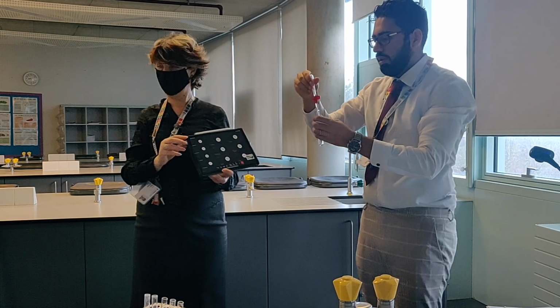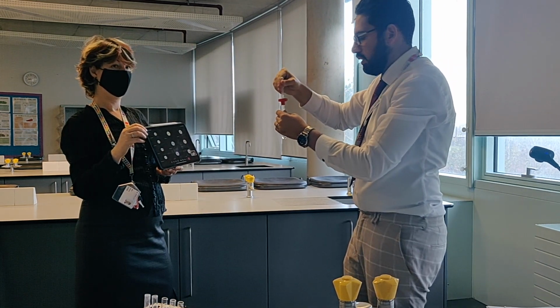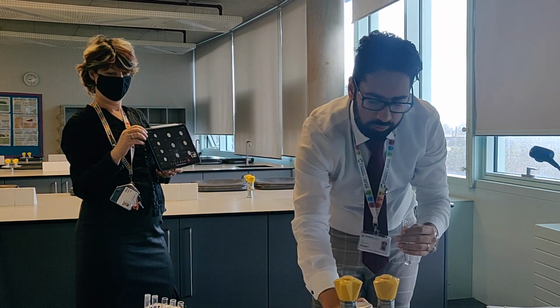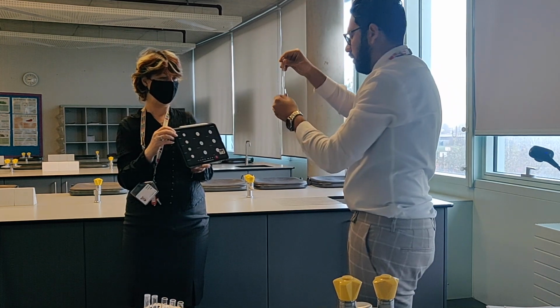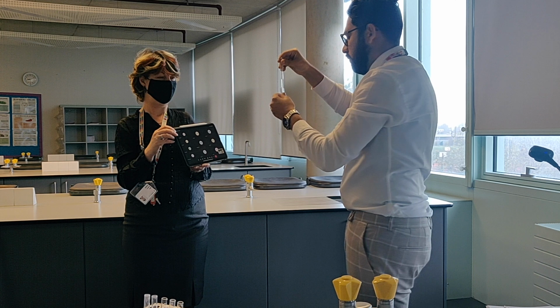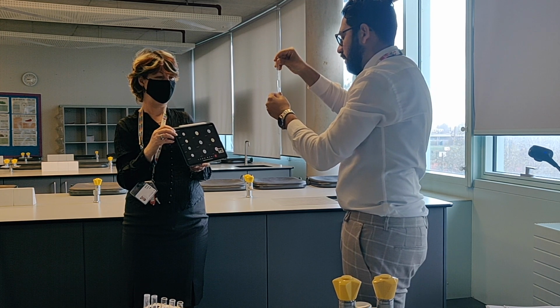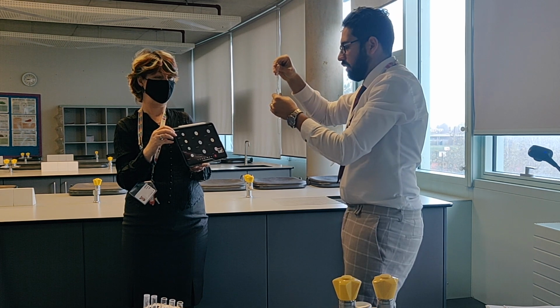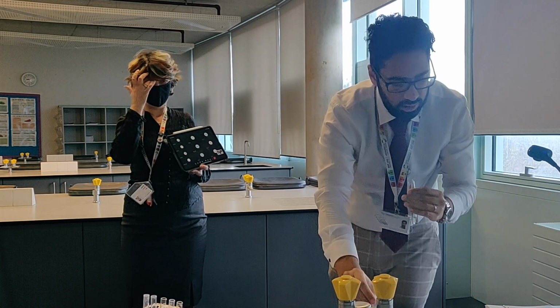Okay, 10 drops again. Ten drops, and then sulfuric acid, 10 drops. Okay, that's 10. I'm going to add a few more, drop it in excess. Okay, this time barely any change.